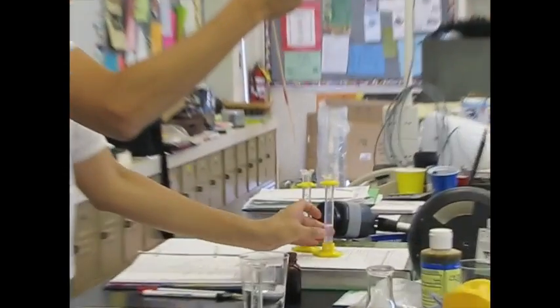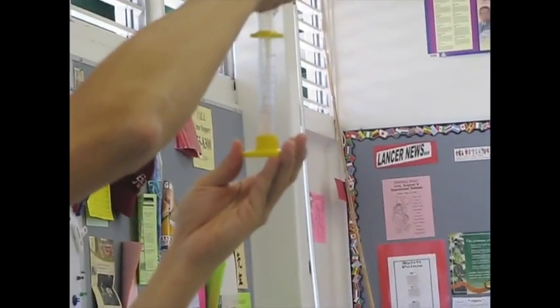And I'm going to do one drop into the one that hasn't been digested. Because it's all still kind of mixed up, I'm going to take this and I'm going to see what happens. What color did it change?